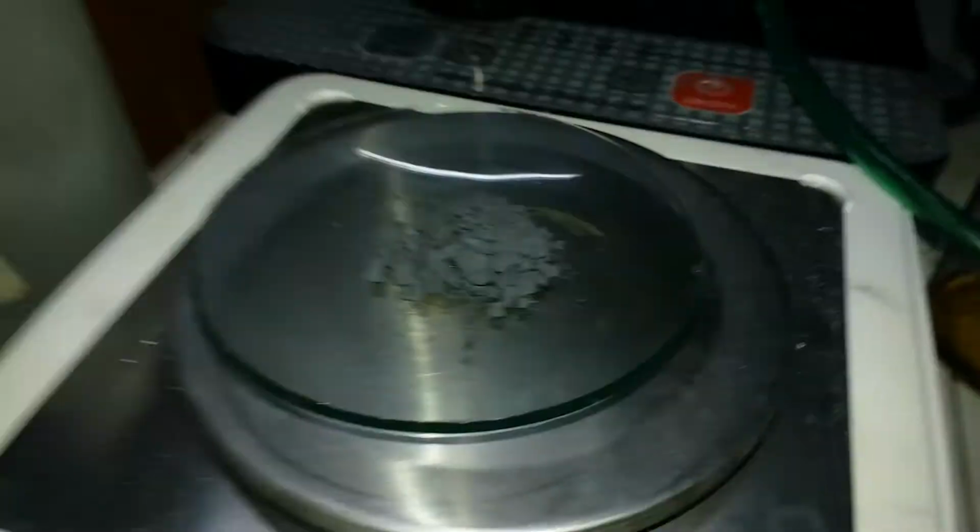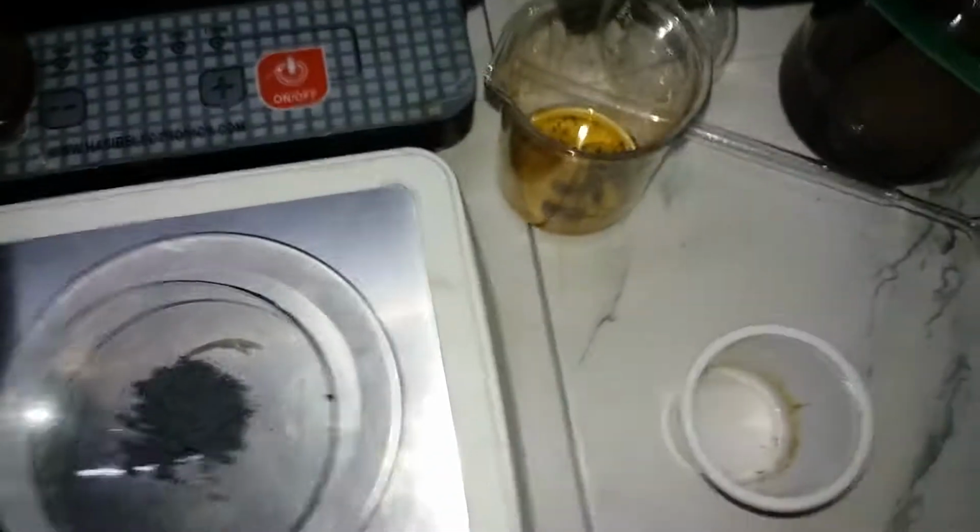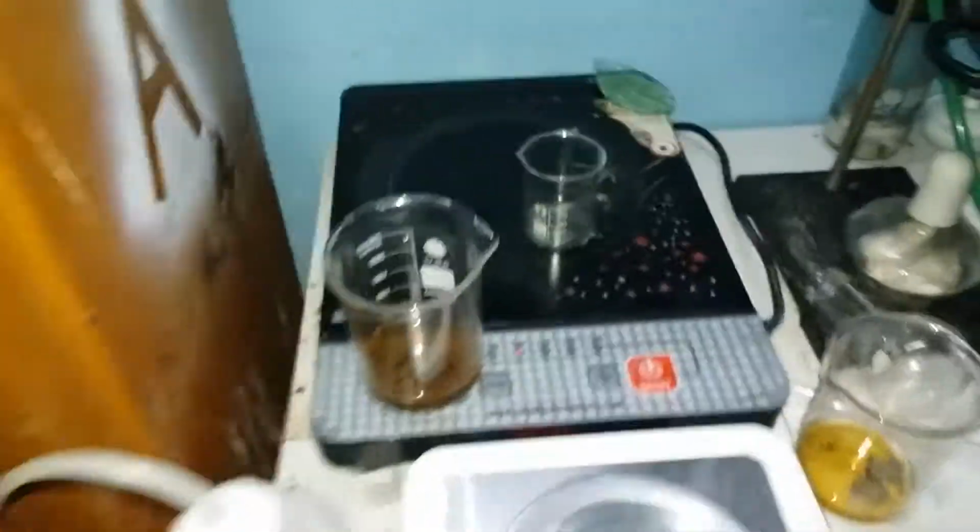Well, that's it for today, but not all. We will recrystallize some of this iodine to pure iodine using what's it called, a sublimation. So we're just gonna take this beaker and this round bottom, and there we are. That's it. So what we're gonna do is, we successfully transferred our iodine here. I'm gonna turn on the power. Wait, there we go. And we have around 2 grams in here.